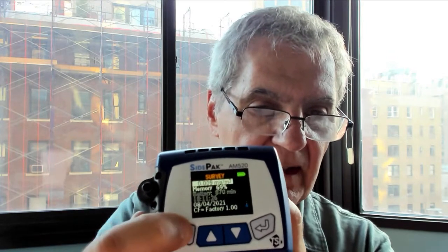If you go here you'll see there are different pages. When you press that button it goes to different views. Notice the memory is 69% full — I'll reset it for you. You have 870 minutes of battery left. That's a long time. It's been factory calibrated.